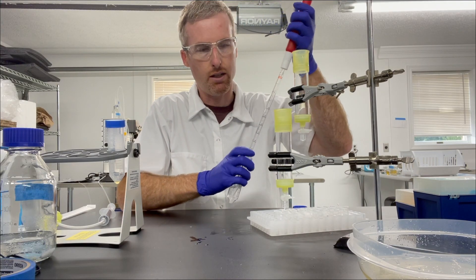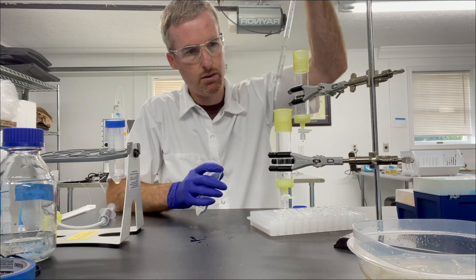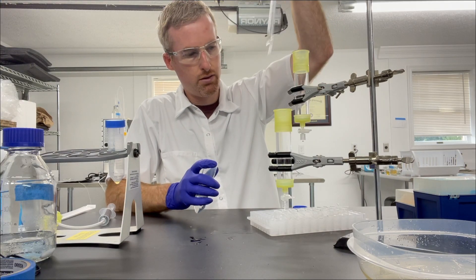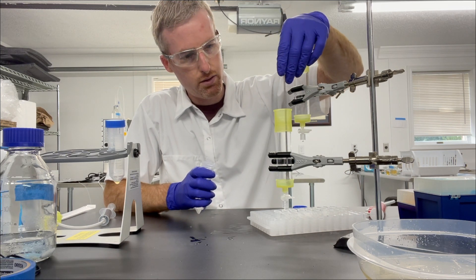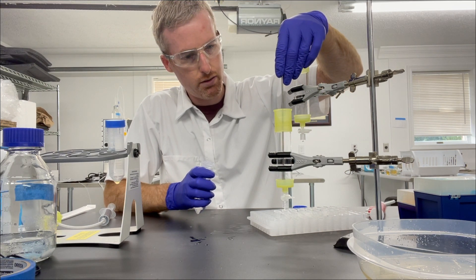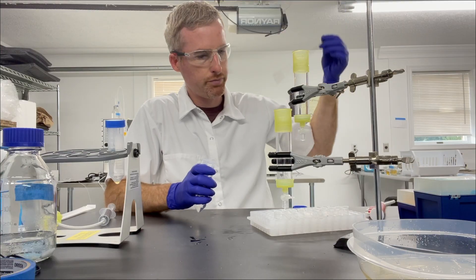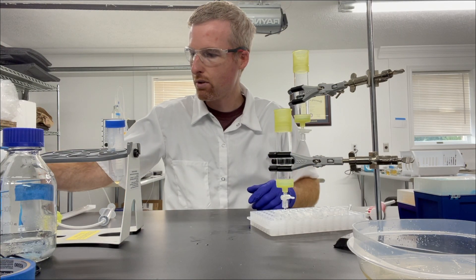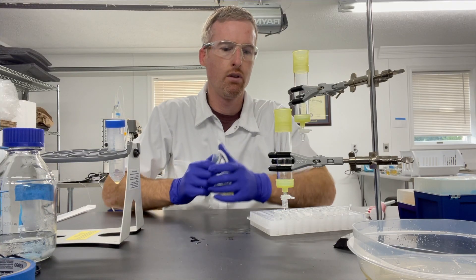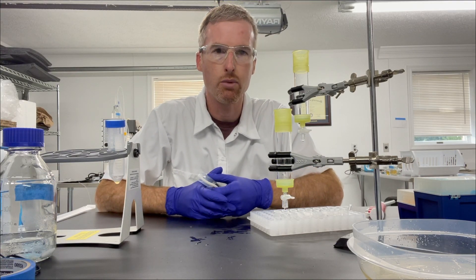So I'm going to turn the stopcock off, mix that up a little bit, give it about a minute.